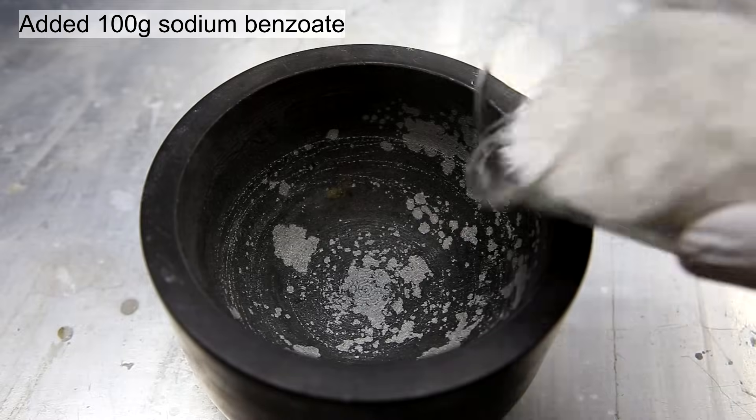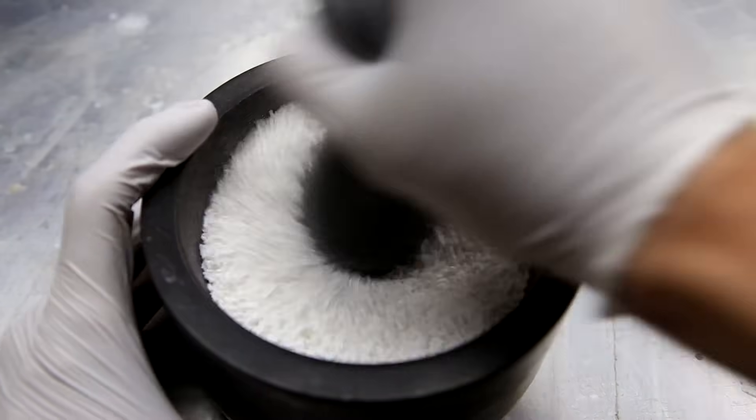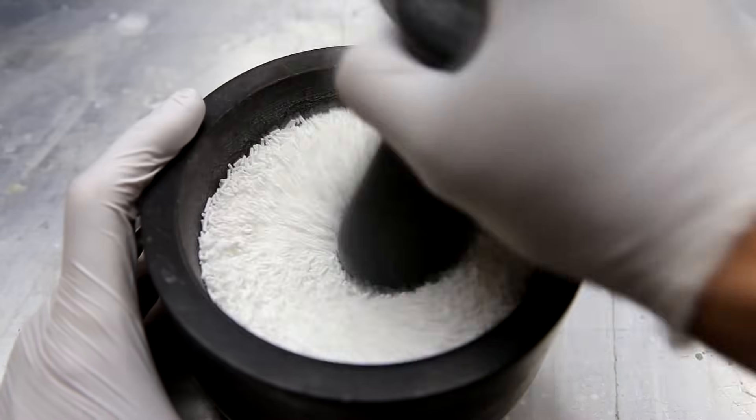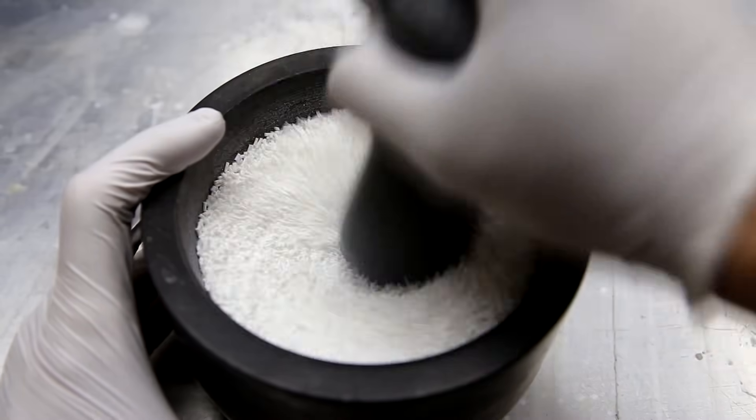To a mortar was added a hundred grams of sodium benzoate. Then using a pestle it was crushed as much as possible. I kind of overloaded the mortar here so it's a little hard to crush but eventually it worked out.